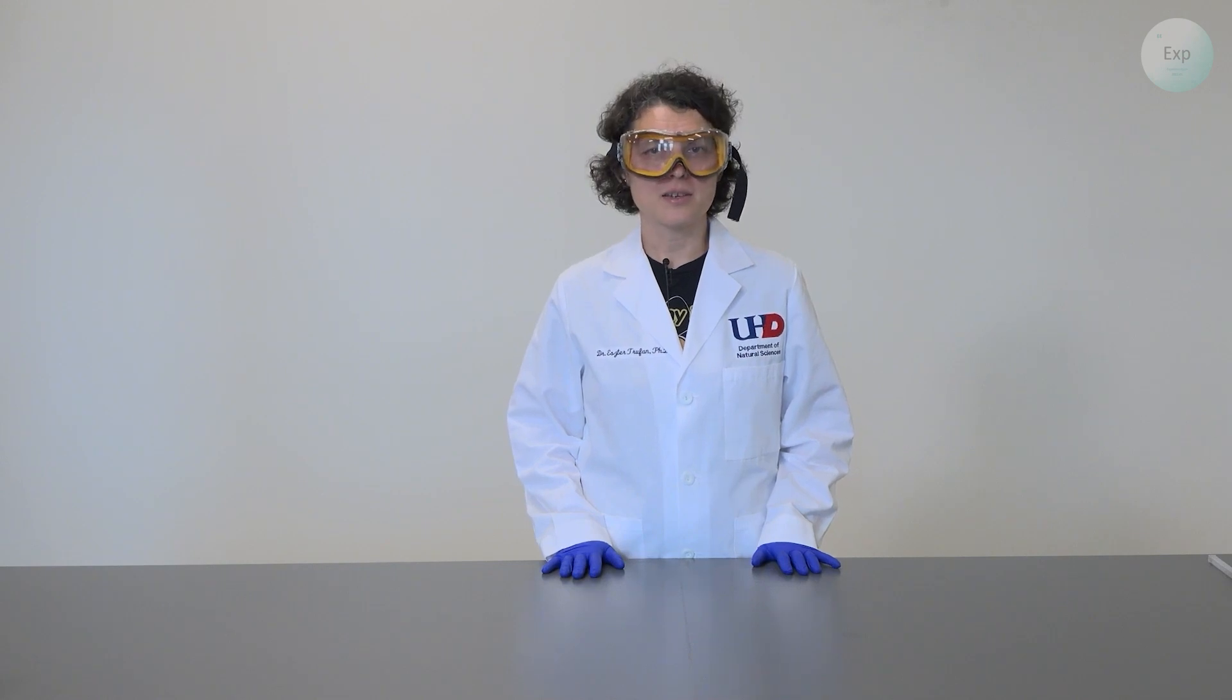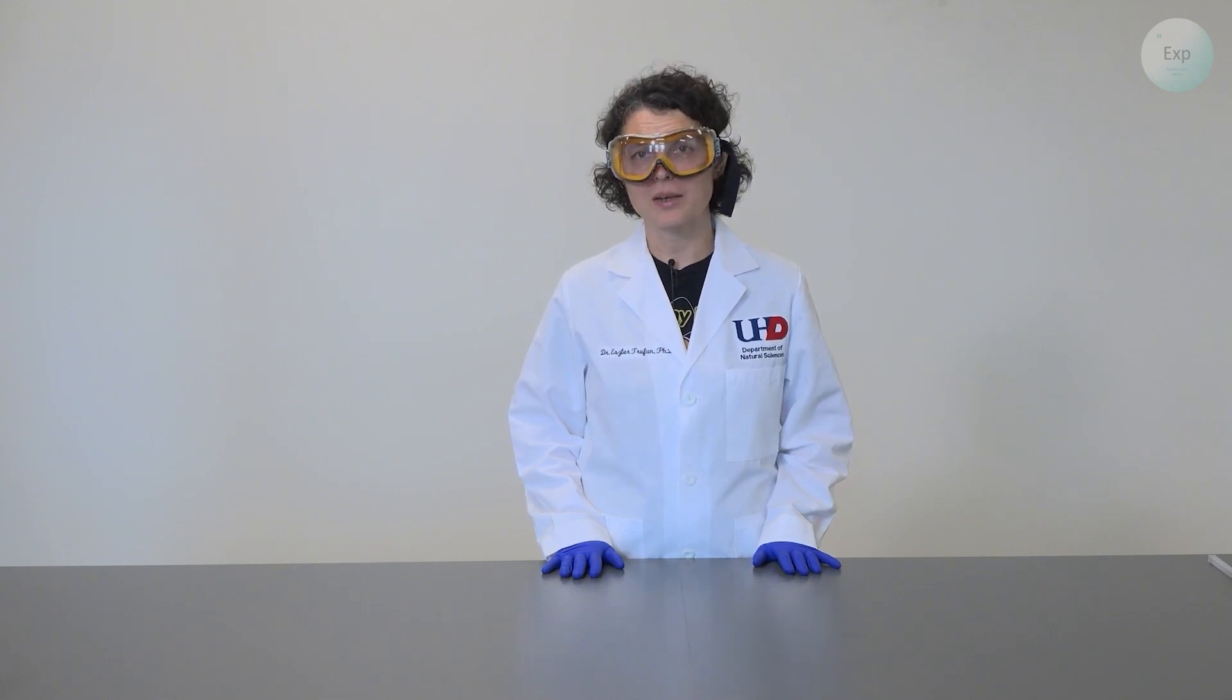Hello, my name is Dr. Esther Trufan and in this video I'm going to demonstrate an experiment through which we find out whether or not calcium chloride has any impact on the boiling point of water.